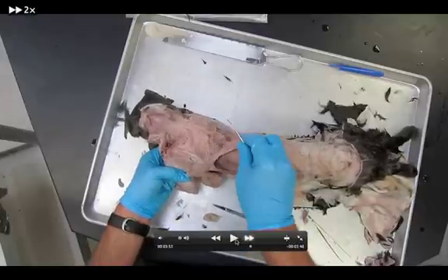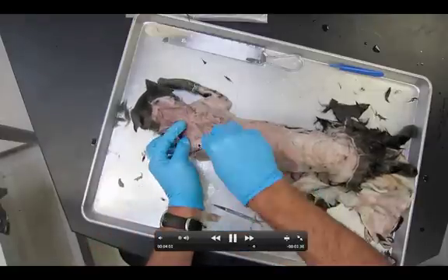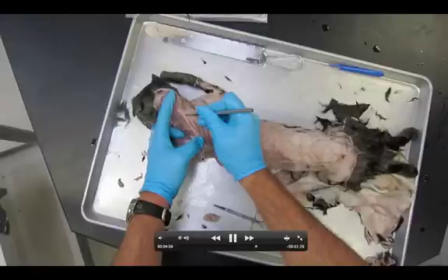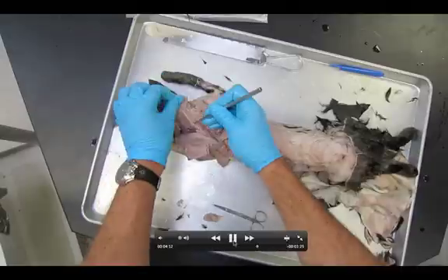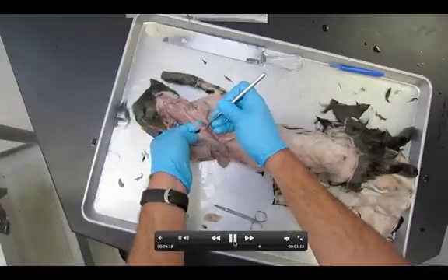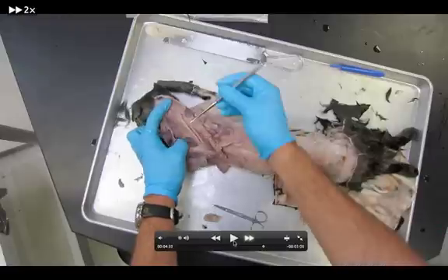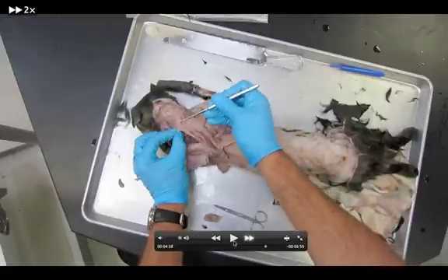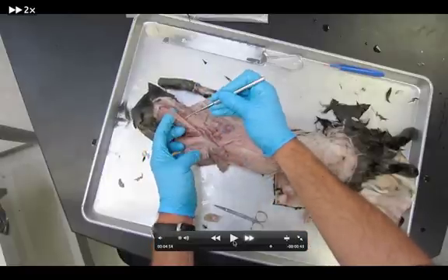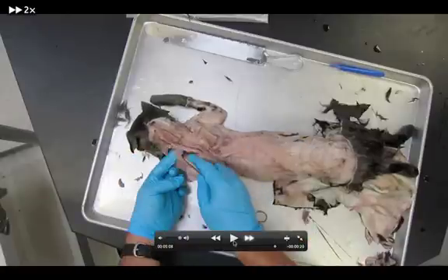The last thing we have to do in this dissection is find the rhomboidus capitis. Notice what I'm doing with the arm — I'm shoving it under the body, which lets the scapula kind of poke out. I'm getting my probe under this ribbon of muscle right here, and this is the rhomboidus capitis. Again, the elbow is tucked under the cat to pull the scapula out. Never tear this muscle — it's in the same category as the levator scapulae ventralis and will never be cut.